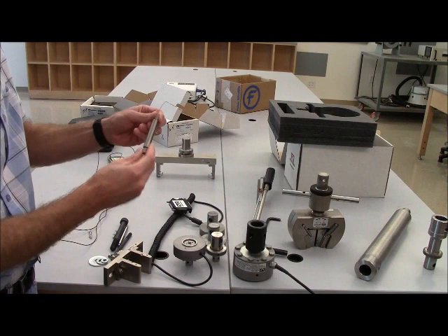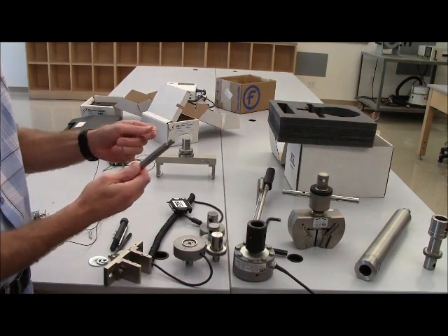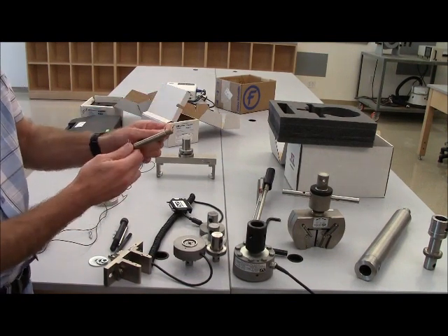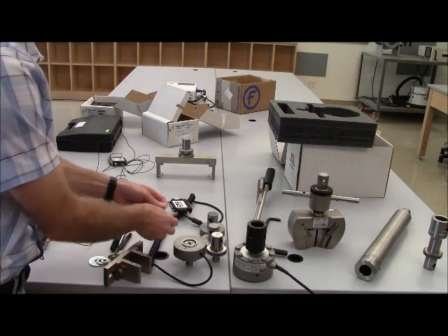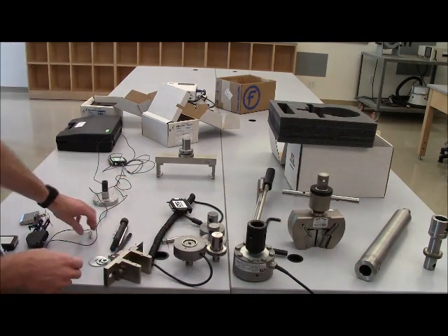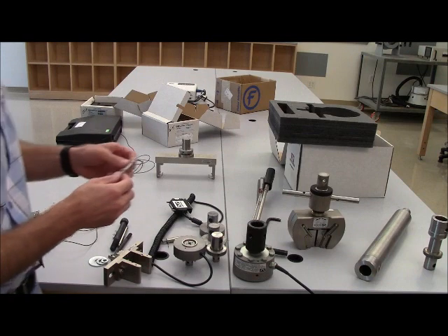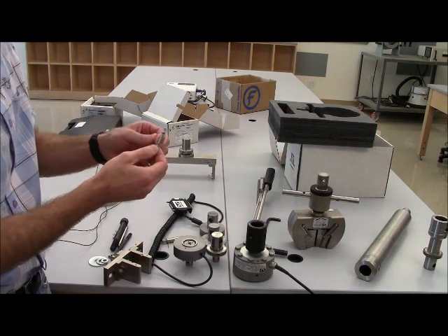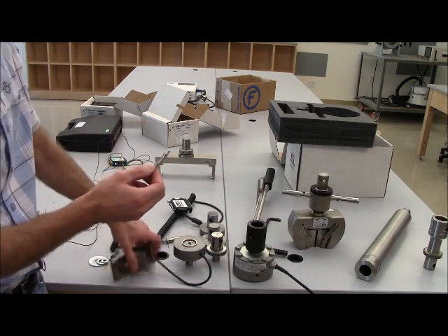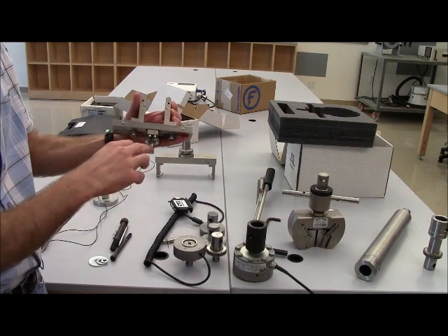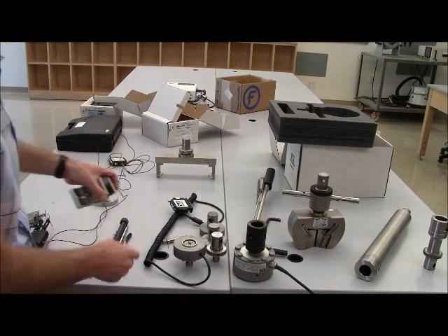Here's the type DM connecting pin with wire clip to keep it in place. As I do more experiments and show you how to put devices on, we'll look at more detail on those. And this is the type OM connecting pin. So for example, it would go through this and with the wire clip on it.